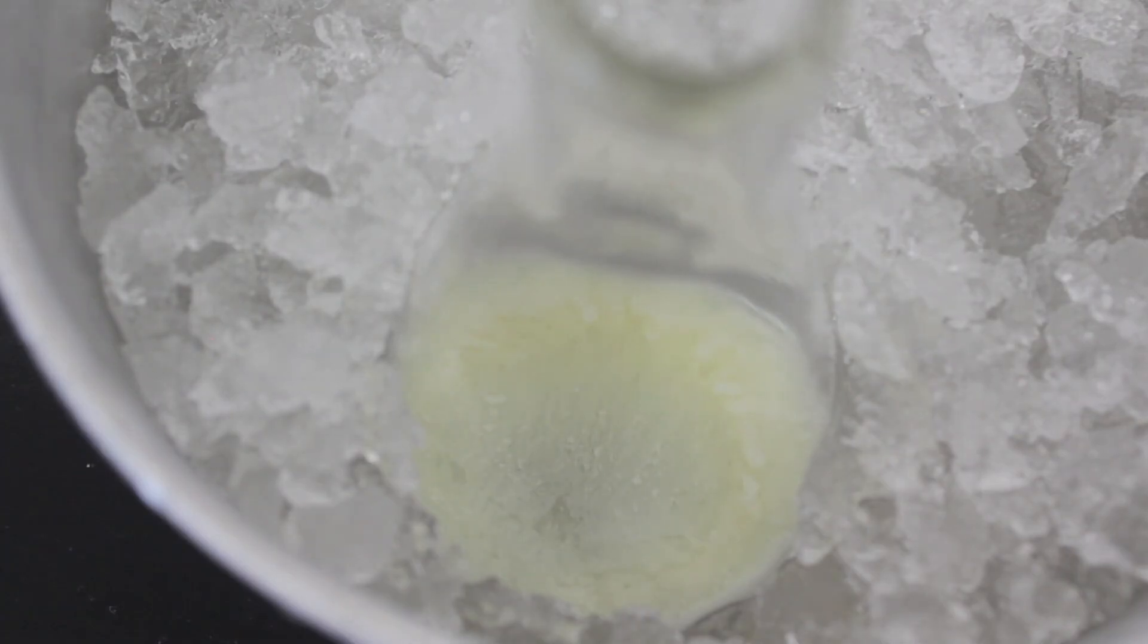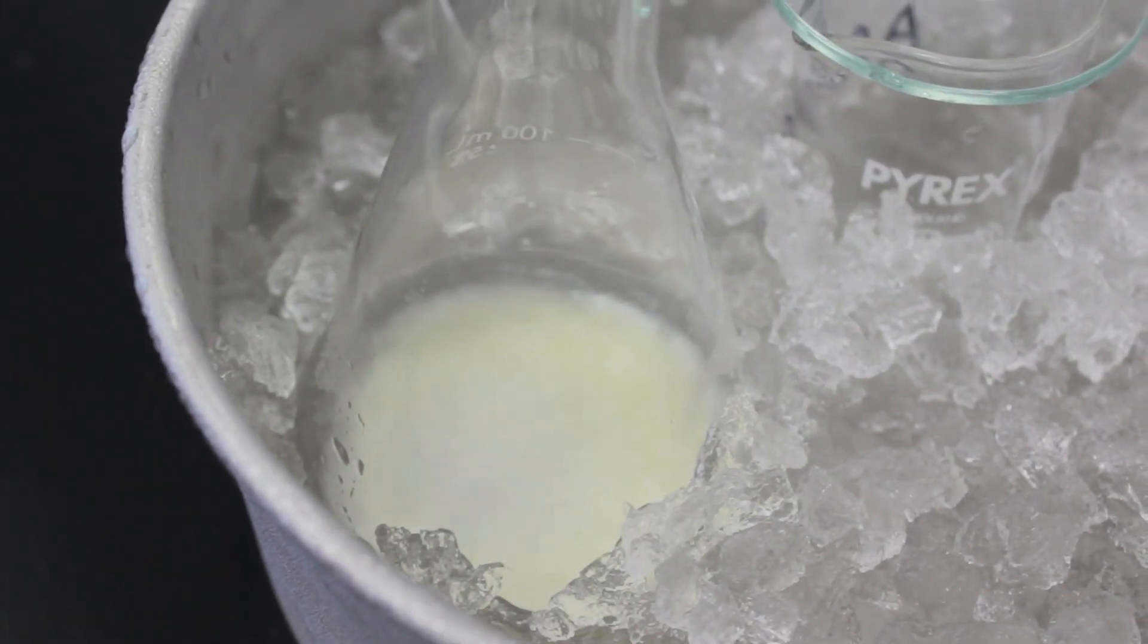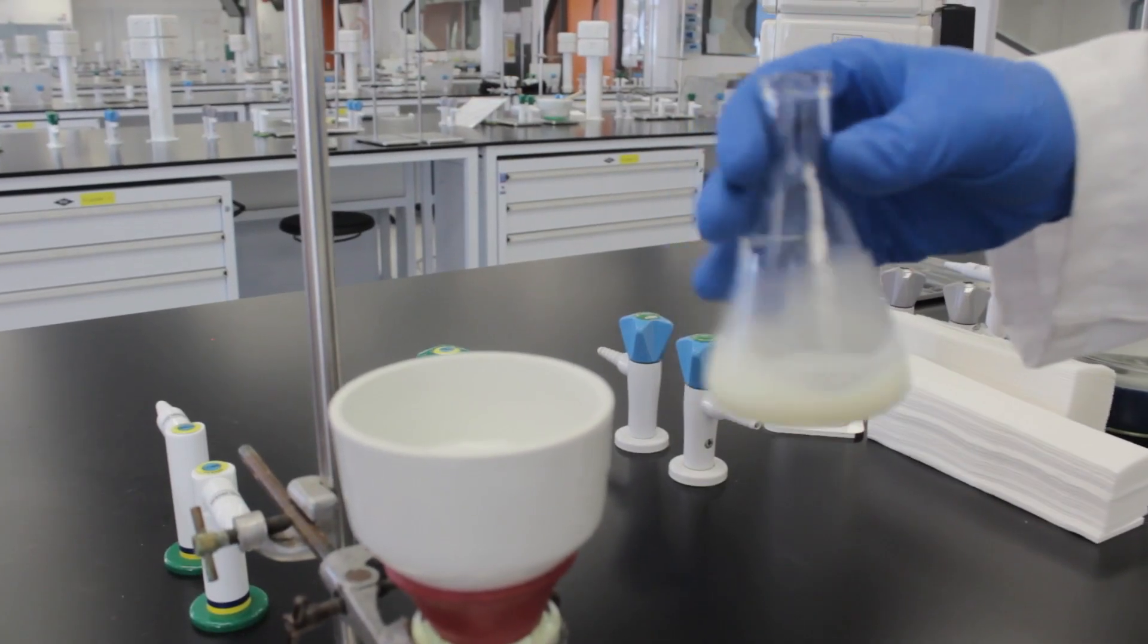You might need to scratch the bottom of the flask with a glass rod to help your product crash out. Vacuum filter your product as usual.